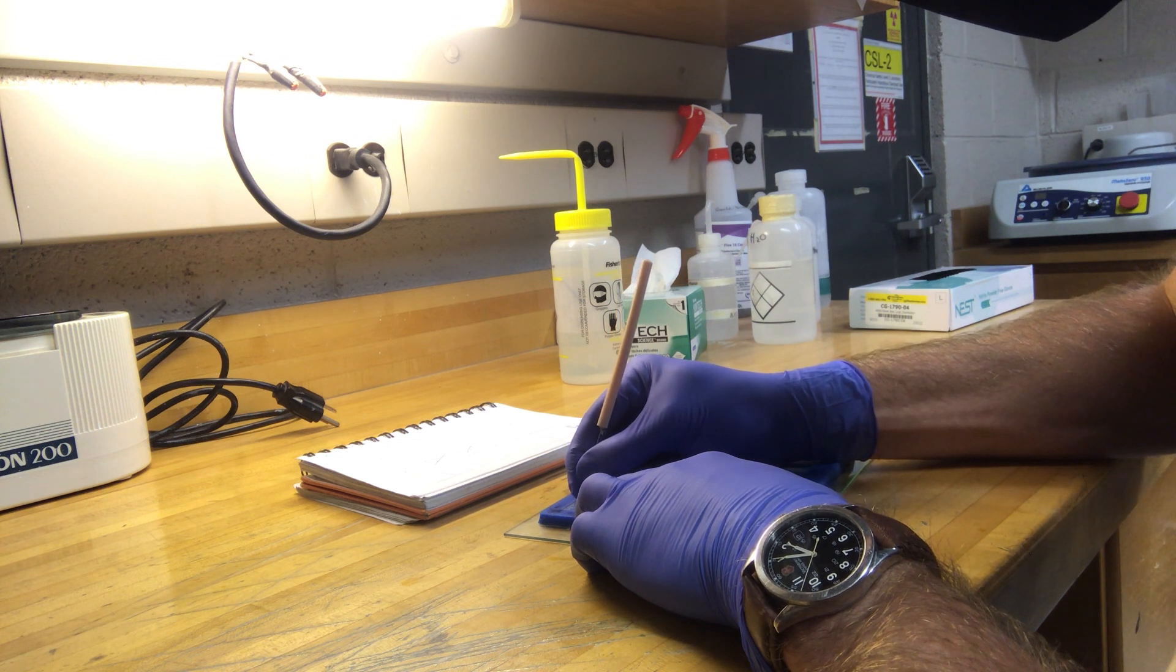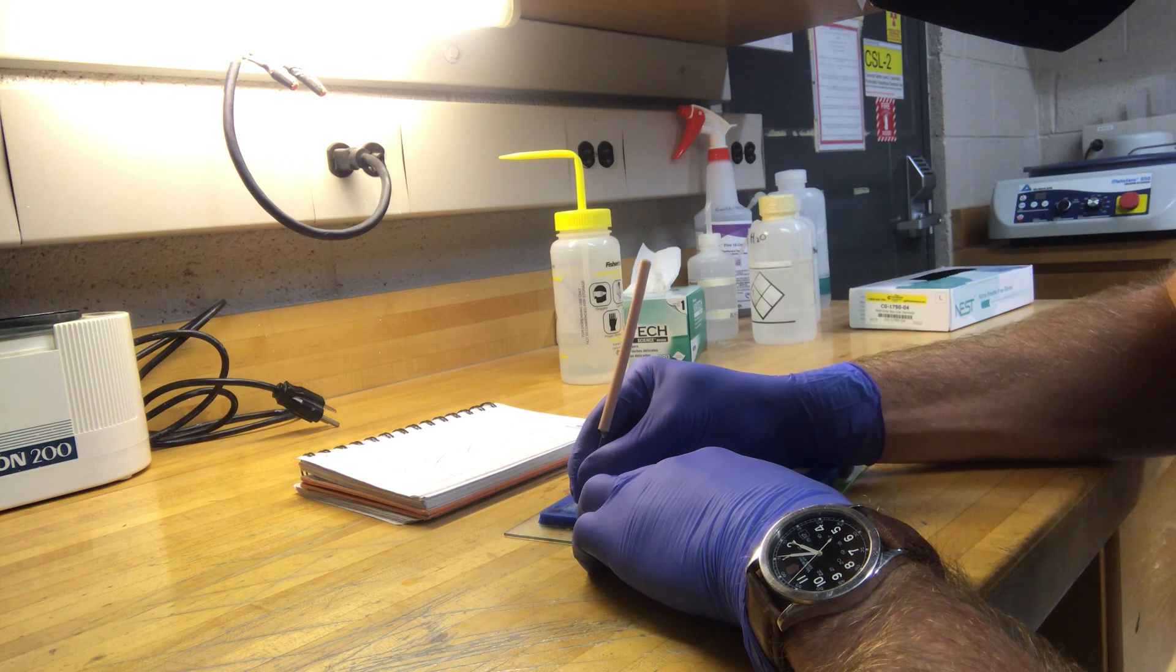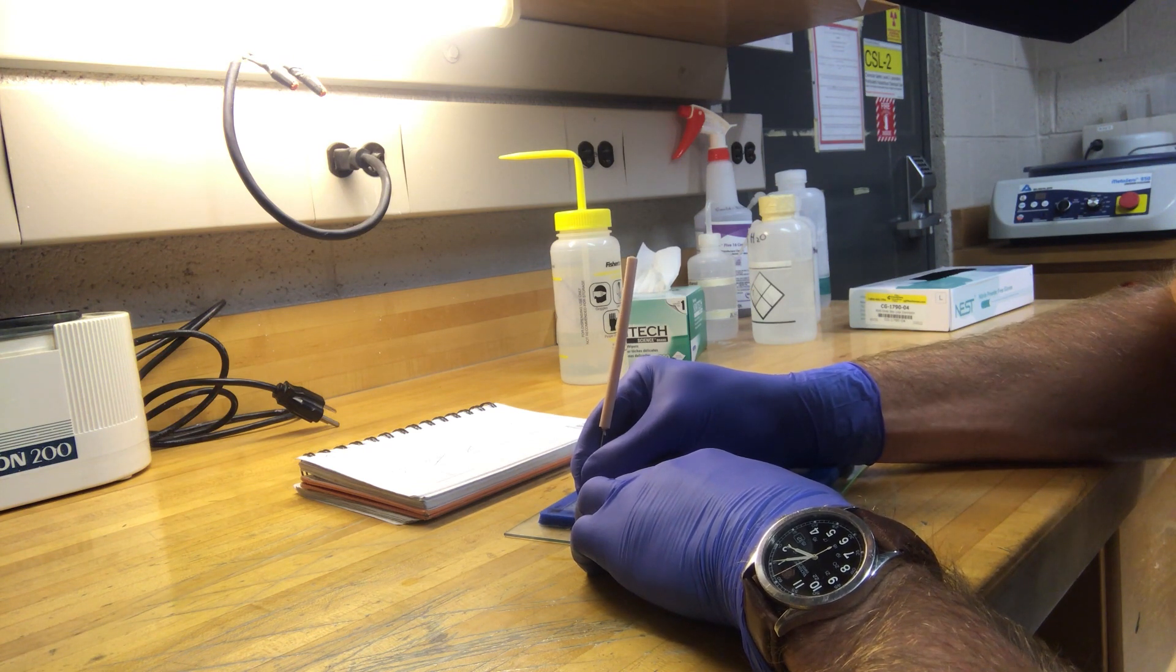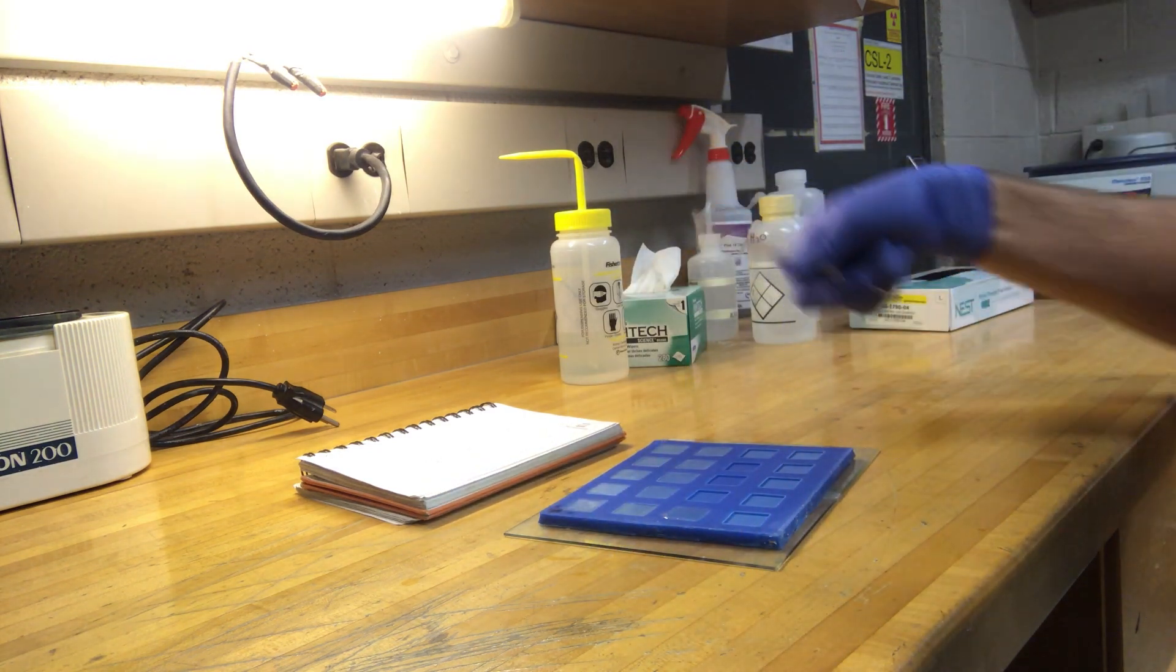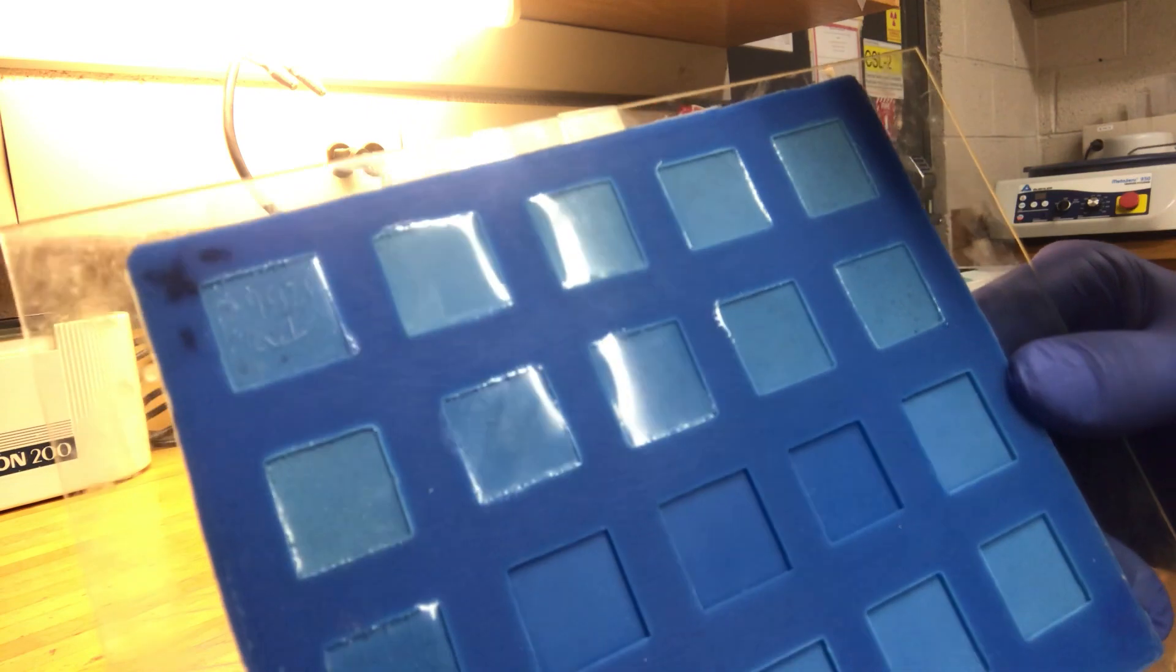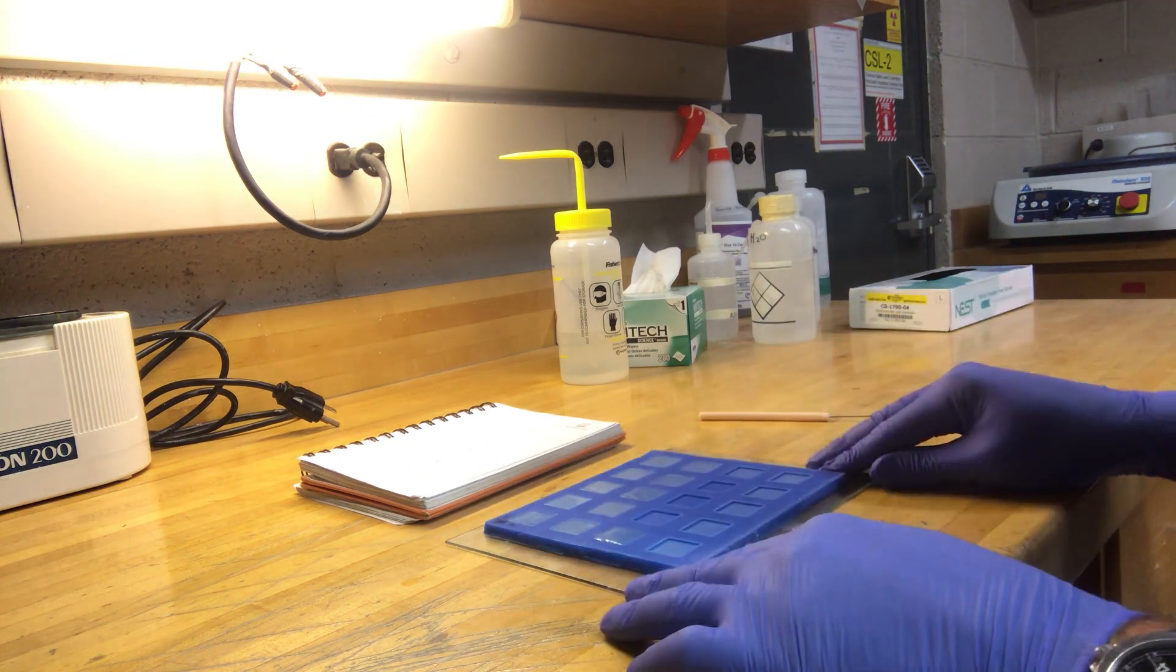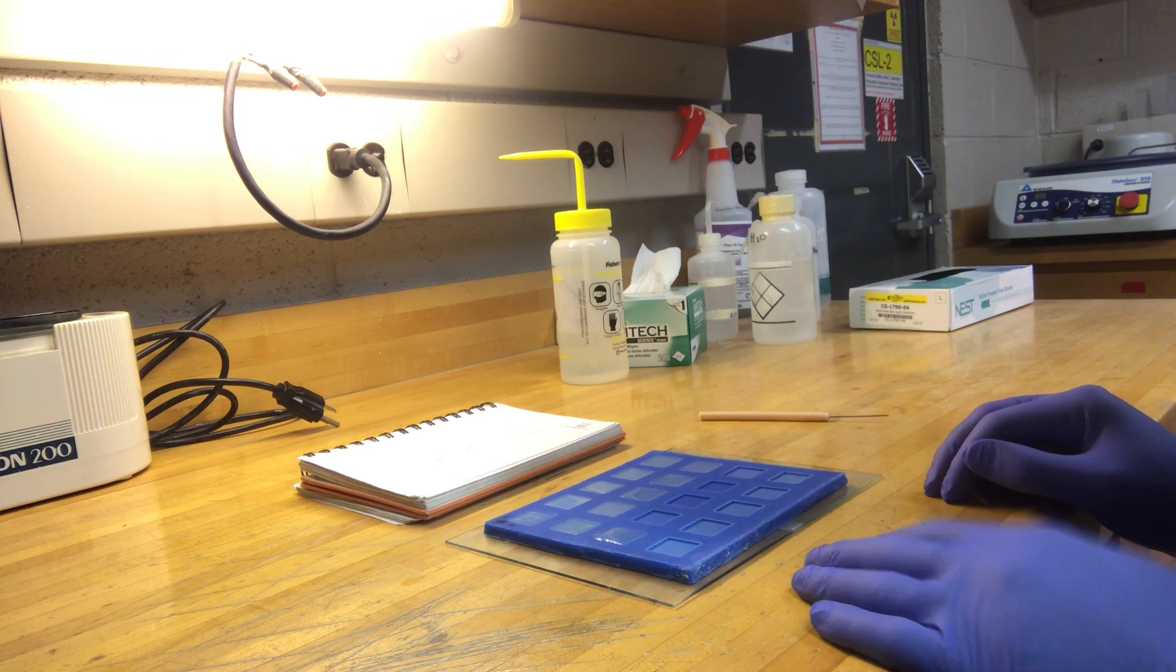So 21821A, and if you can't fit it all in one line, make sure you do it. You want to stay away from the margins because you're actually going to bevel those down later on. You can see nice and clearly that the sample name is etched in that one. You repeat that for the remaining samples. And then when they're all done, you can then remove them from the mount.